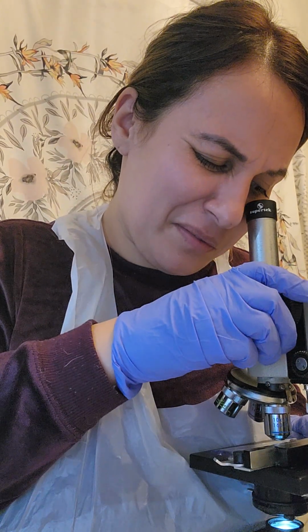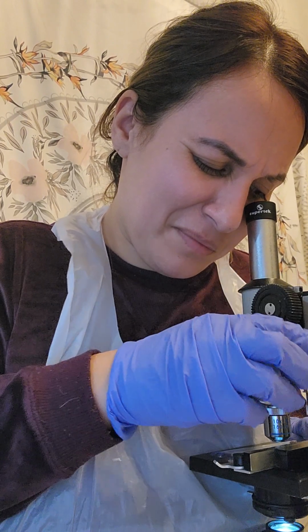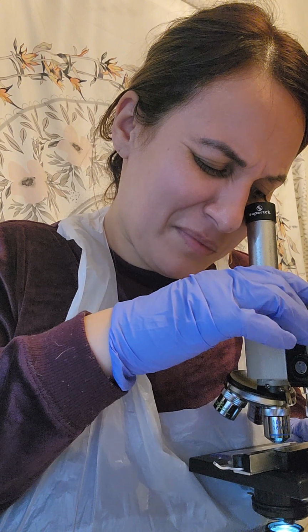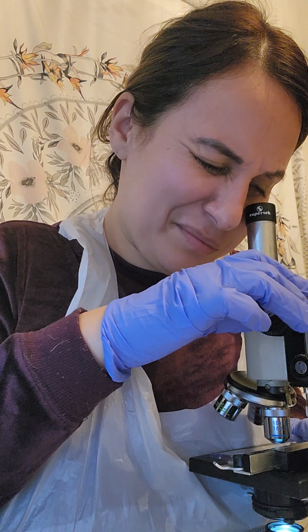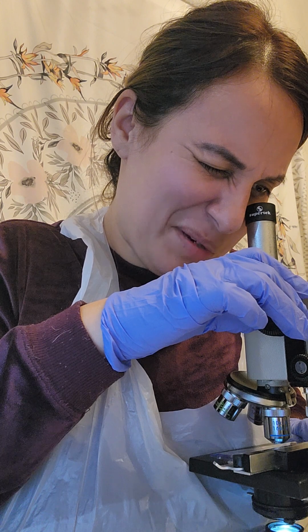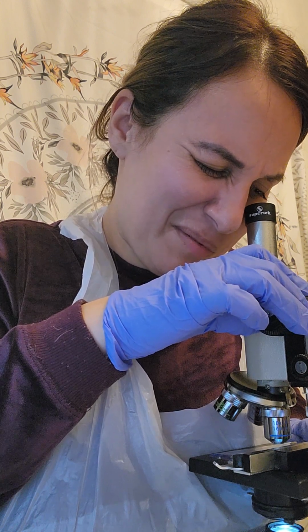It looks to me like this is about a 1 millimeter field of view.